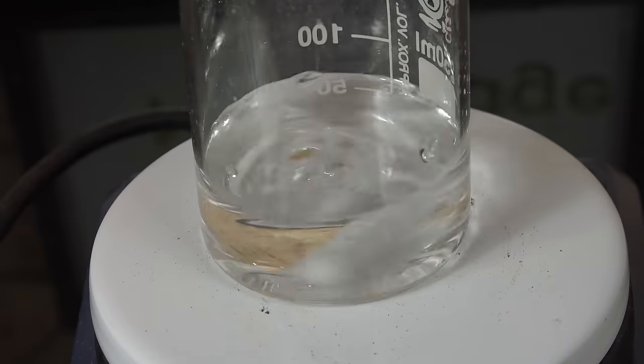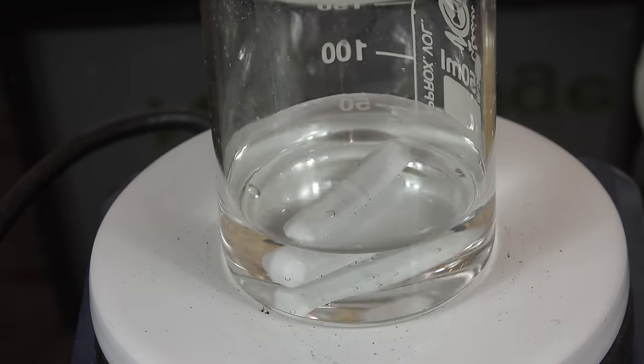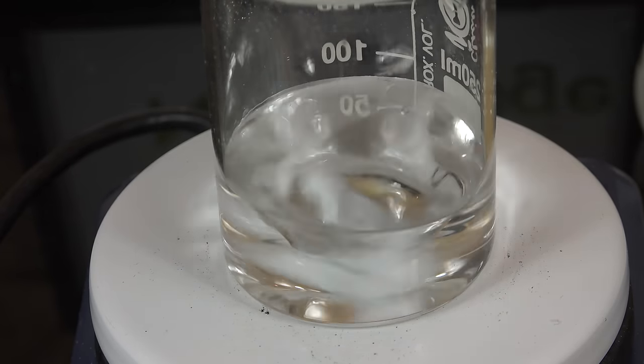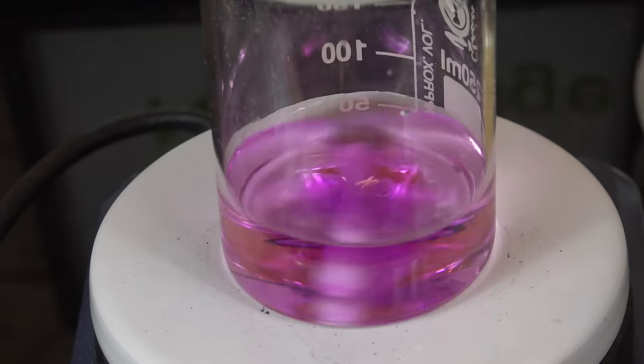Now our first test is to get a sample of the supporting titration mixture of about 50mL and add in one drop of the potassium permanganate titrant and stir. There should be a lingering pink color.